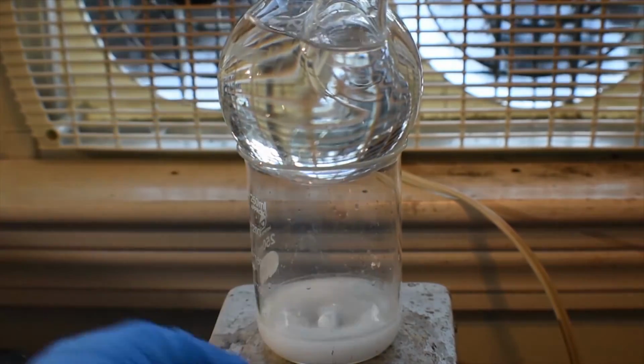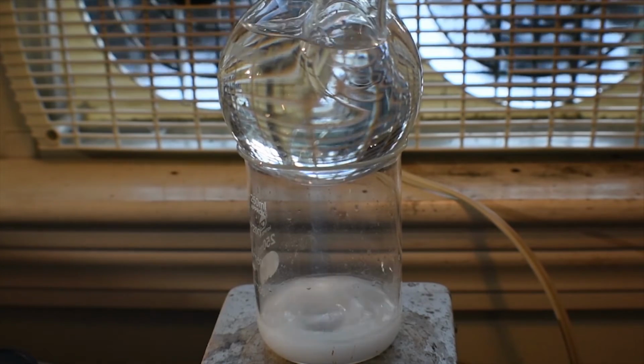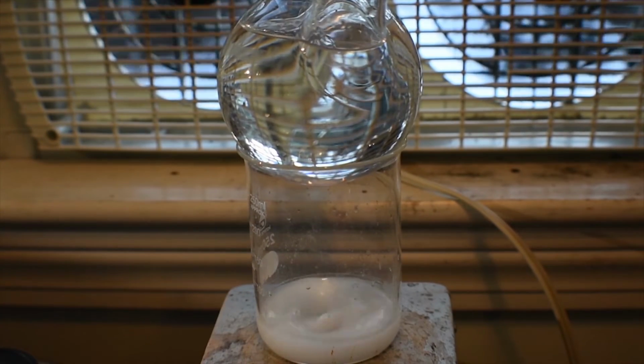So, let me go ahead and turn on the heating. And you're going to want to heat this at a gentle boil, pretty much, and keep heating it, changing out the water in the condenser with cold water every so often, because it will get hot enough to boil with all the steam coming off. So, yeah. It's going to take a few hours for this reaction to complete. You'll know it's complete when pretty much all of the nitrogen dioxide evolution ceases. Then you can go ahead and take it off heat, and I'll just come back when it's been a few hours.